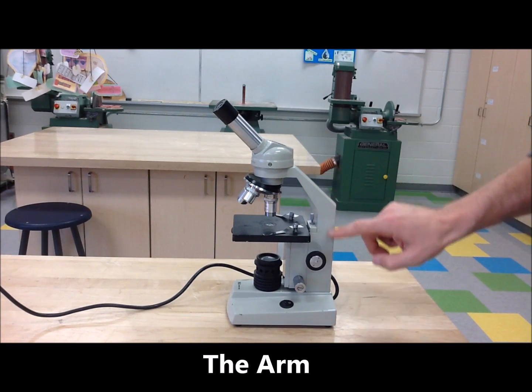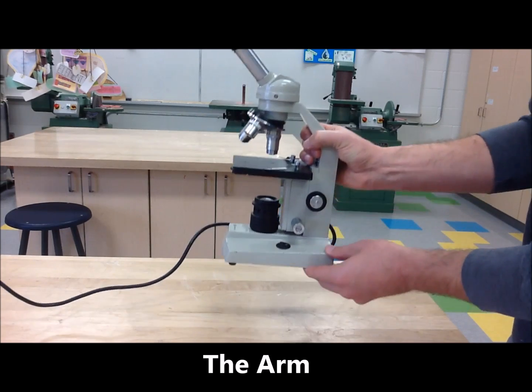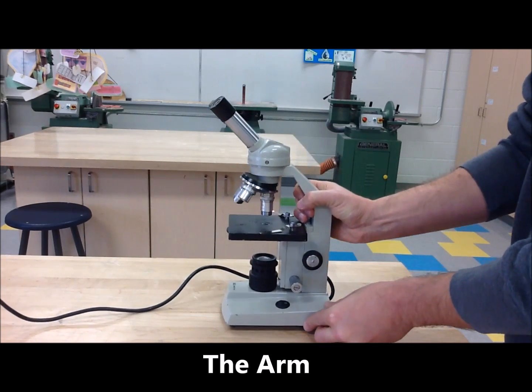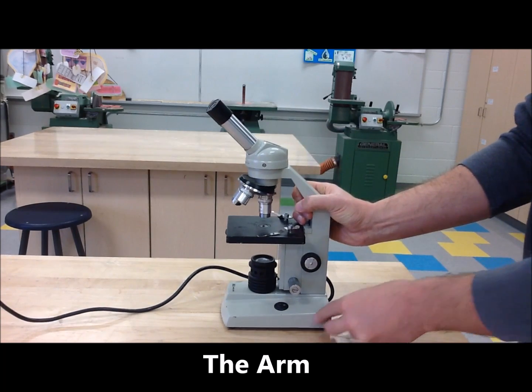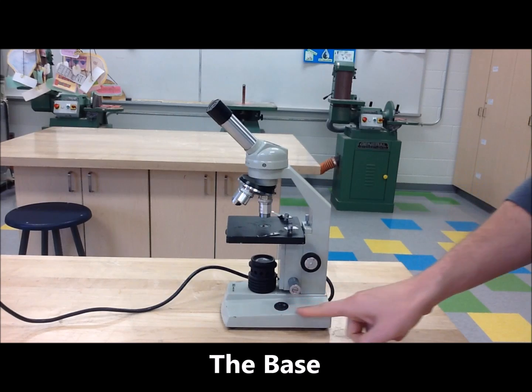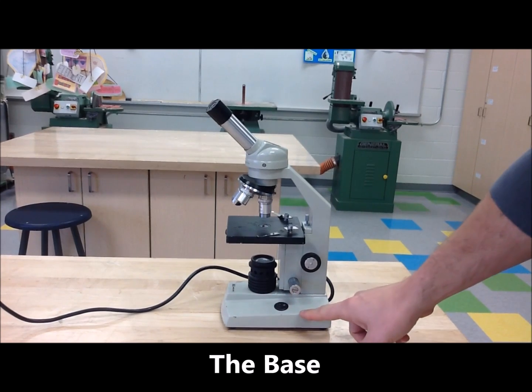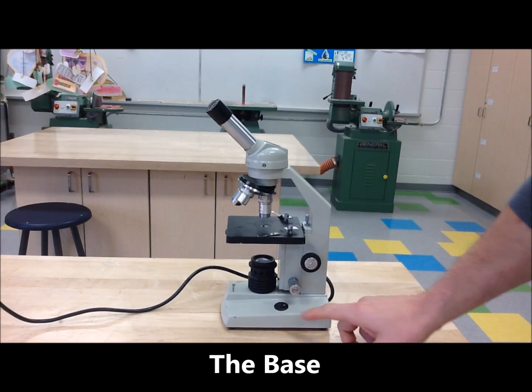The arm is used to safely carry the microscope and also keep the tube in place. The base is the stable foundation for a microscope.